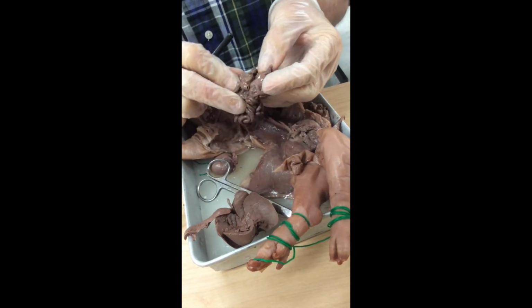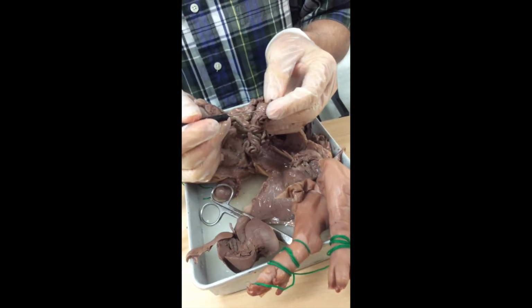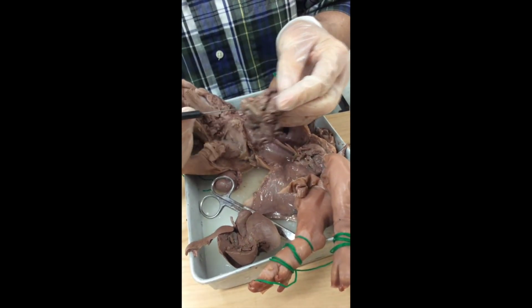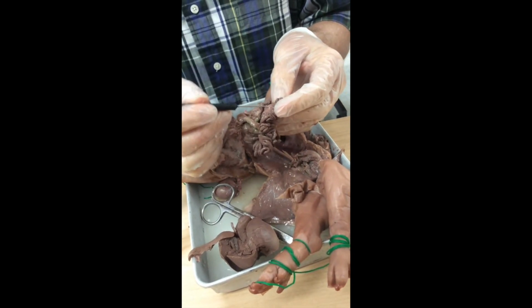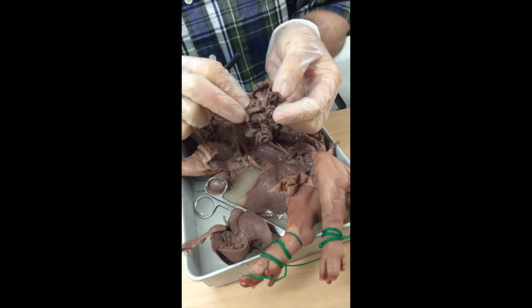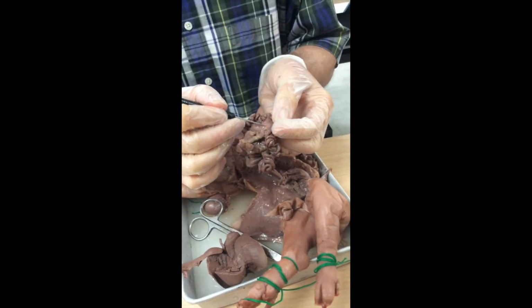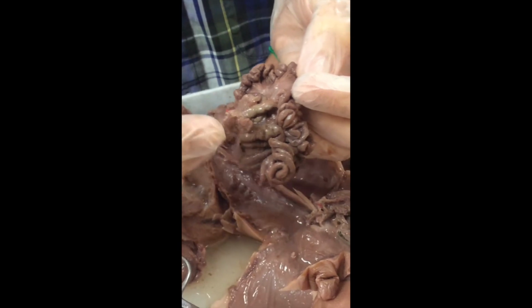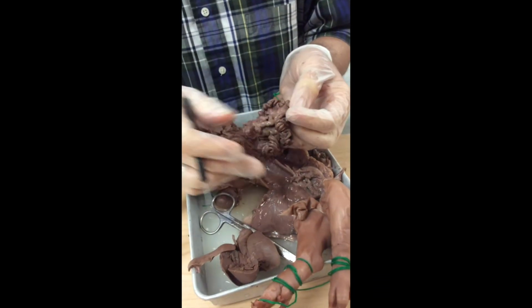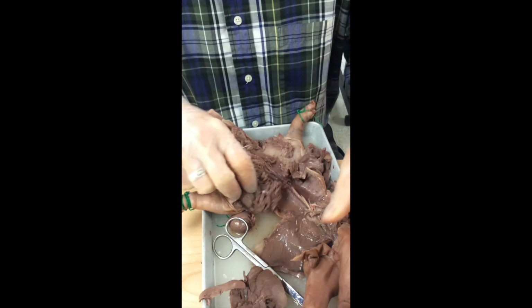You would notice that the intestines are all held together. The connective tissue that holds them together is called mesentery. Did I use the term mesentery just a little bit ago for the stomach contents? I meant meconium. This is mesentery, and in many of your circumstances, not so good in mine, but you'll be able to see that the mesentery is loaded with blood vessels. You see a little bit of red latex in there. We've got huge blood supply to the intestines, which is not a surprise because we need the blood to pick up the food that's been digested by the intestine and carry that throughout the body. So you're going to tease that apart, the great intestine tease competition.